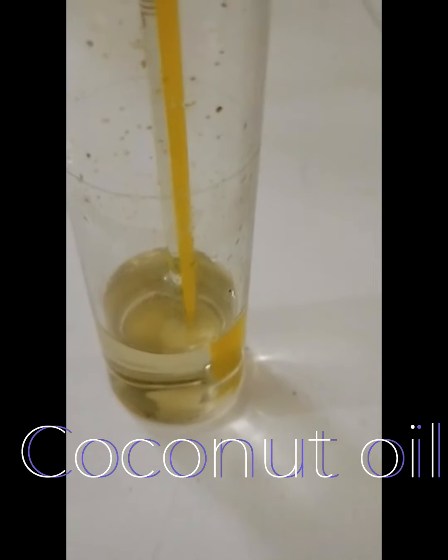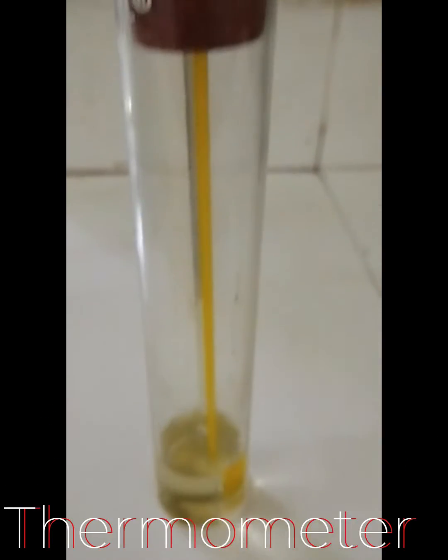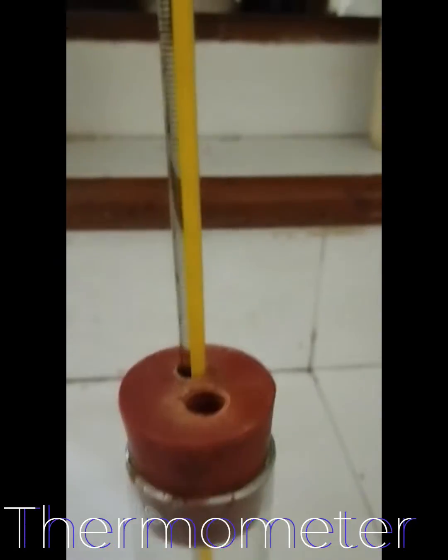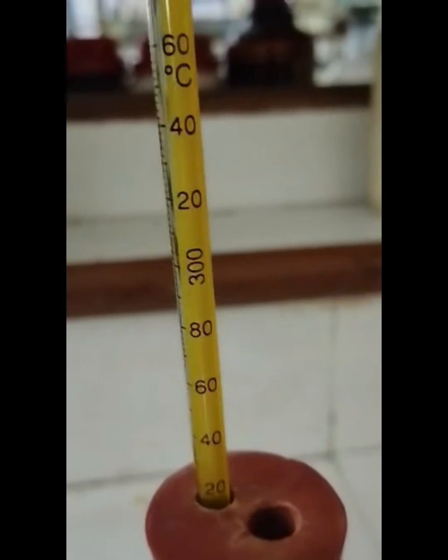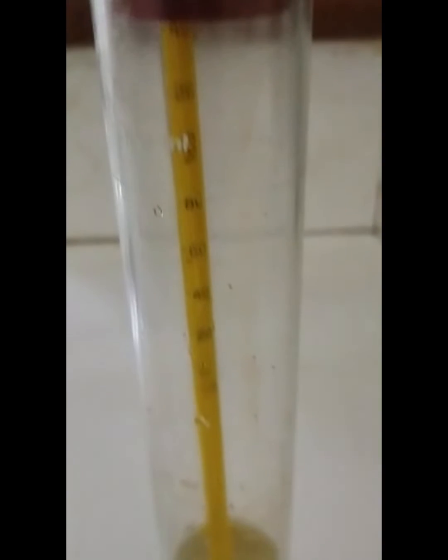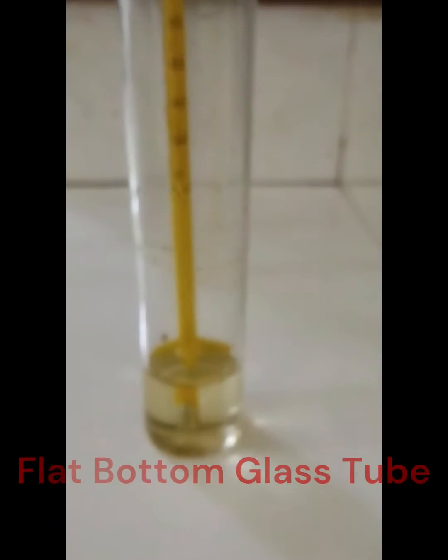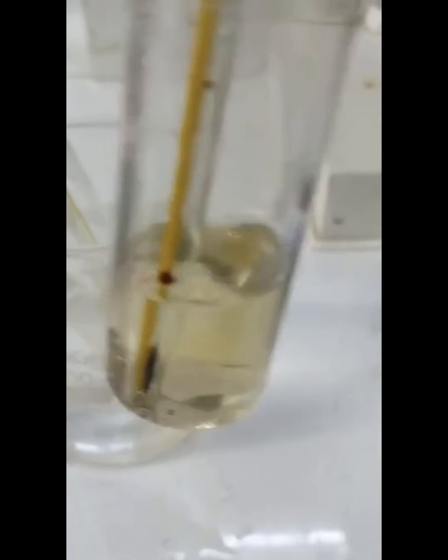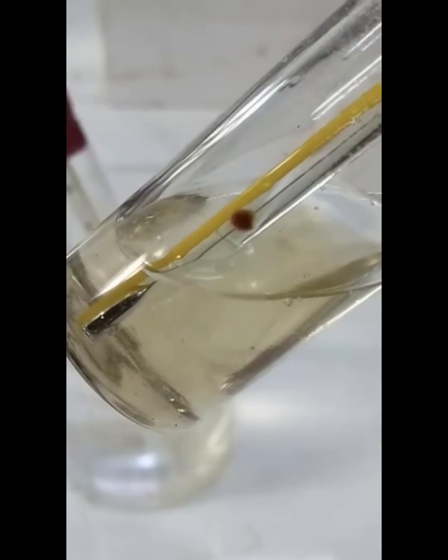I was not having the cloud and pour point apparatus, so what I took was a simple flat bottom glass tube, a boiling tube, and a thermometer to show you how to estimate cloud point. I have taken coconut oil here for easy reference. You just have to put a thermometer inside because what we want is to note the temperature. Then you have to take a beaker with chilled water and put the tube inside.